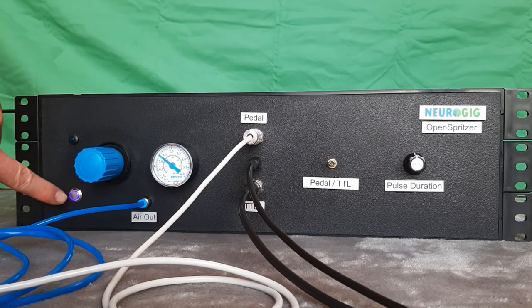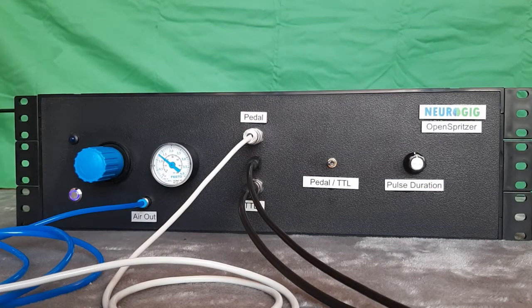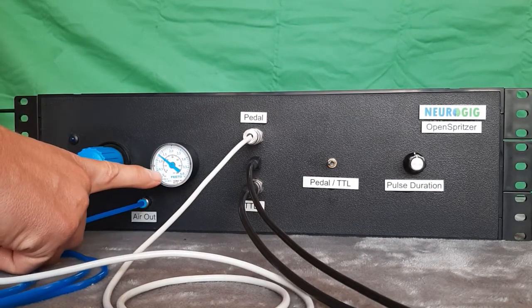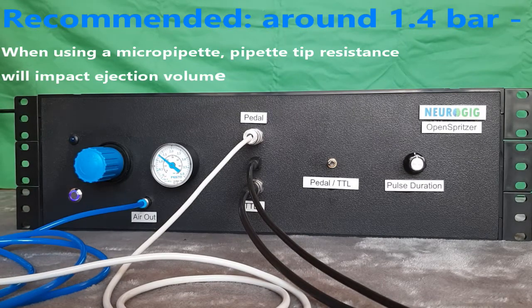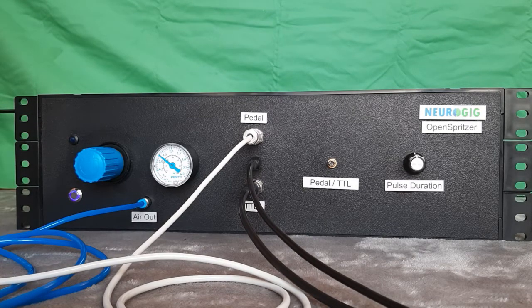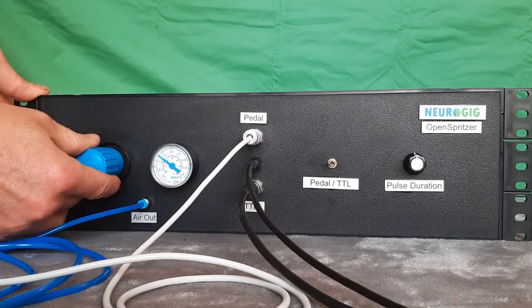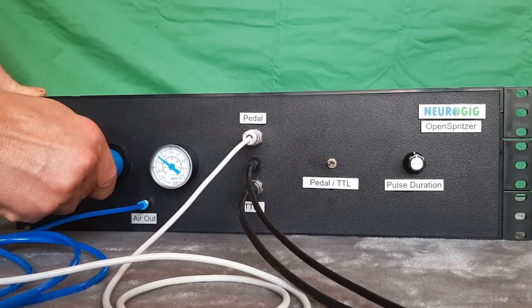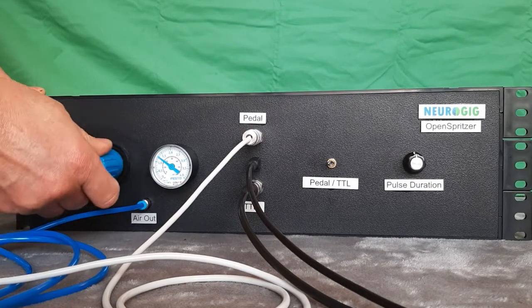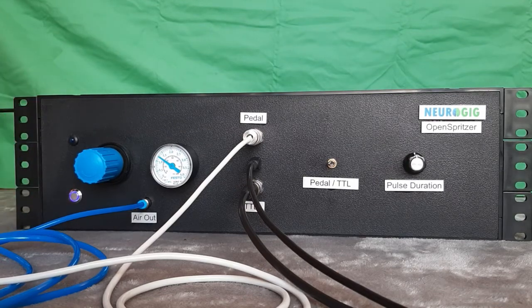After switching on the OpenSpritzer, first check whether the pressure is what is recommended. This should be between 1.2 bar and 1.8 bar for a nice and crisp pulse. Pressure can be adjusted on the pressure regulator. First pull out the adjuster and turn clockwise for increased pressure, anti-clockwise for decreased pressure. Pressures above 2 bar may damage the valve.